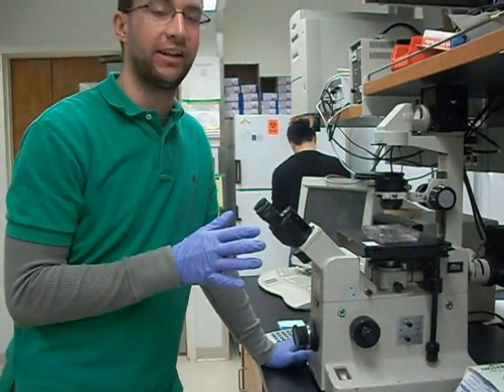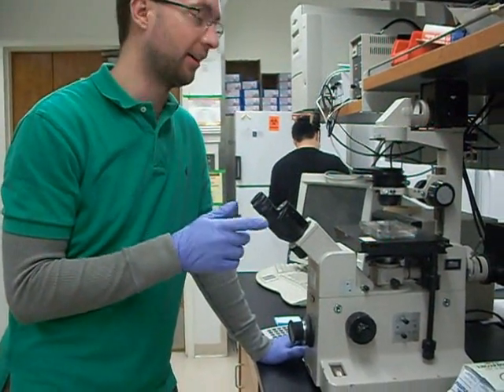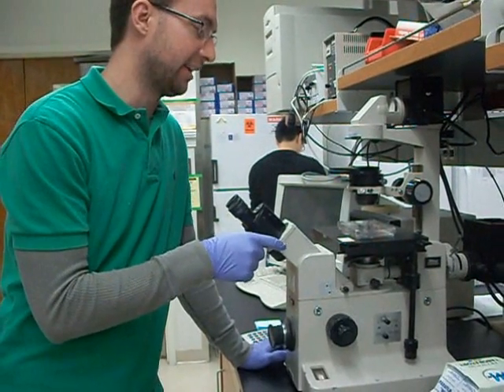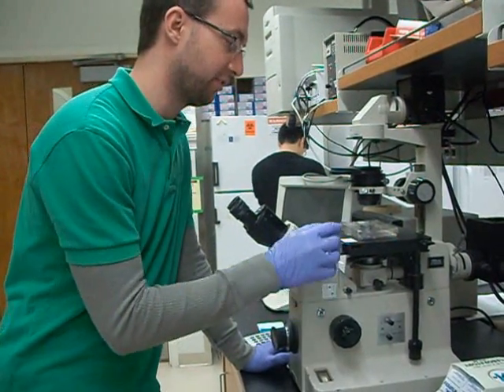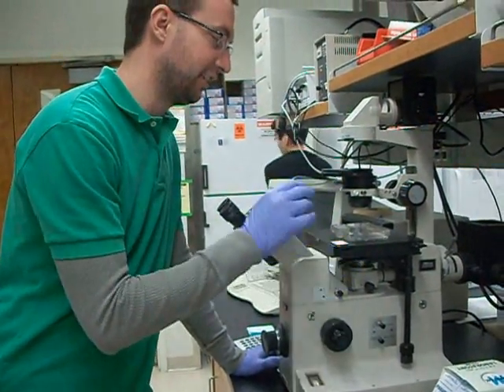Always make sure before you start doing anything with your flow experiment and setup is that you go ahead and take a look at your cells to make sure that they look good and everything's fine.